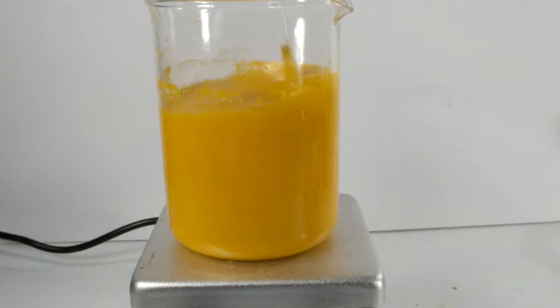There is an awful lot of lead iodide here, and the stirrer is having a hard time keeping up. I'm stirring it manually, and pretty soon after the stir bar gets bound up again and the product starts to settle fast.